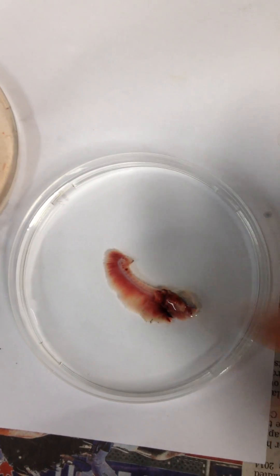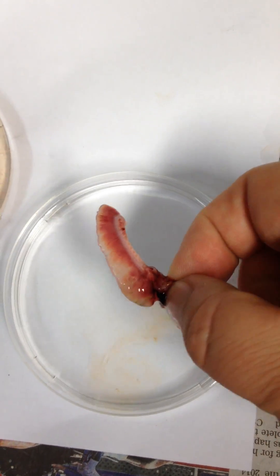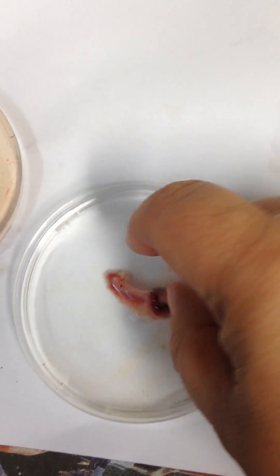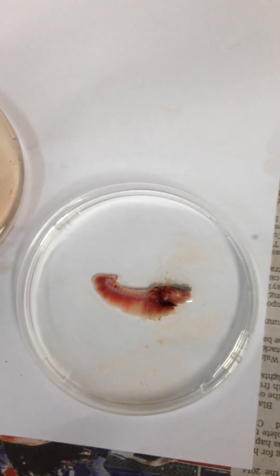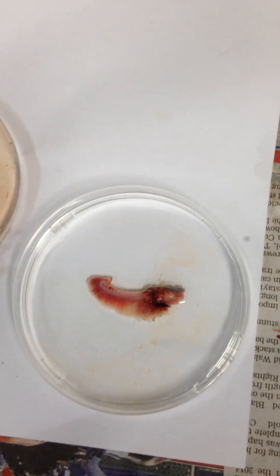All nice and spread out and feathery, and when we take this out of the water the gill filaments clump together, but when they're in the water they spread out. When they're spread out it increases the surface area and allows much more of the water to touch the surface of the gill filaments and the lamella.